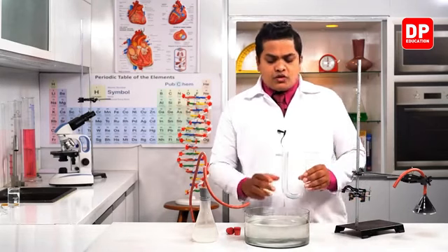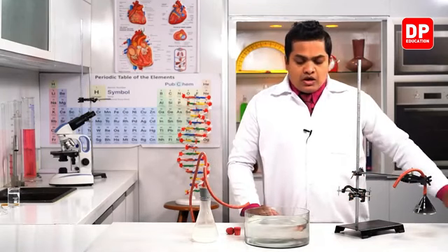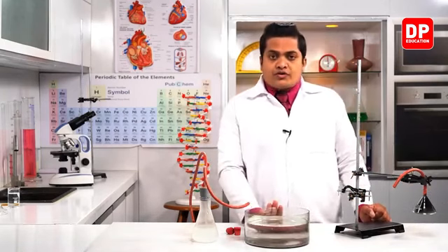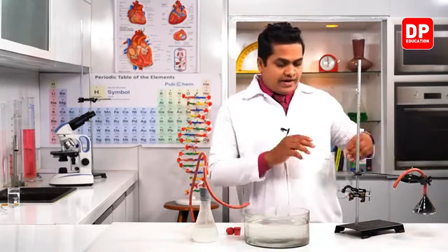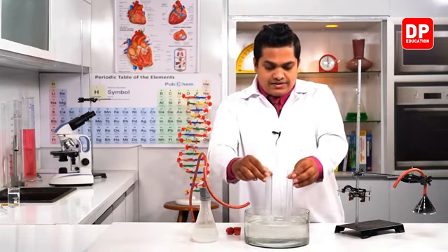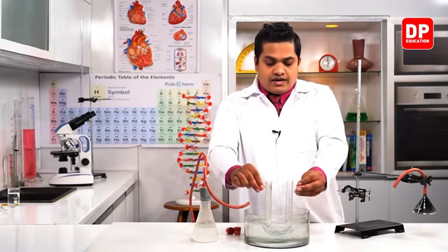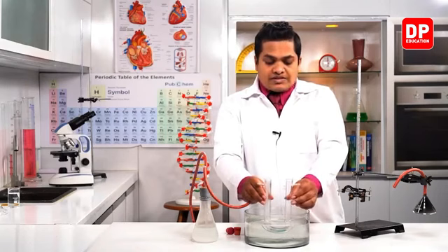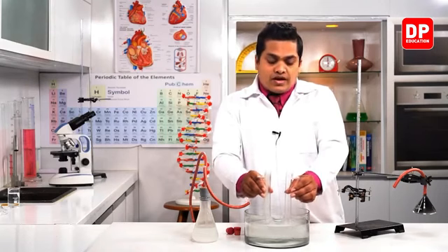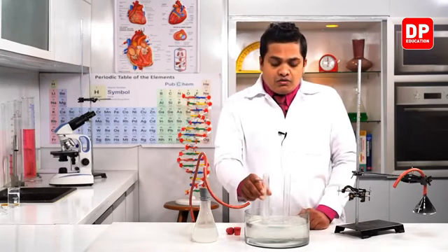I'm going to ask you a simple question. Why do we need to keep a water trough like this? You saw that I kept the water trough like this and dipped the U-tube inside the water trough, and I have fixed it to the two delivery tubes by keeping copper sulfate within. So what's the reason for dipping this U-tube inside the water trough?